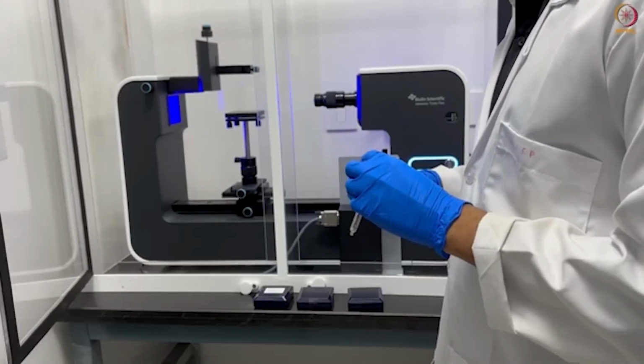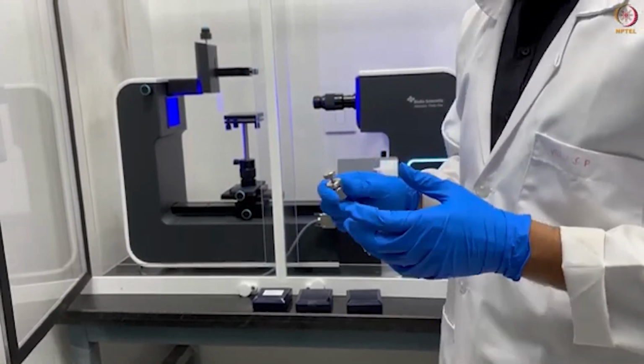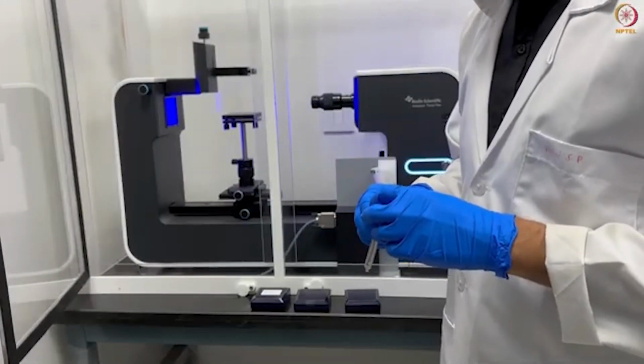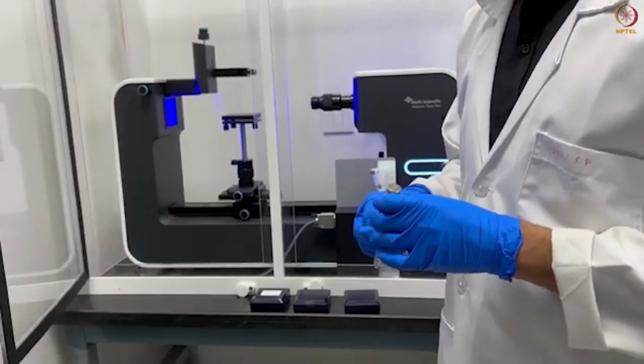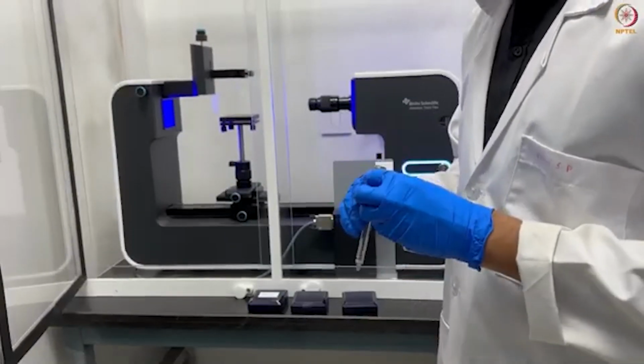Now let's see how we measure the contact angle of our glass. Right here, I will show you the contact angle measurement of a glass slide to understand whether the particular glass has a hydrophobic or a hydrophilic nature. I am using a normal glass slide available for microscope purposes with the help of water to determine the hydrophobicity or hydrophilicity of the glass slide.